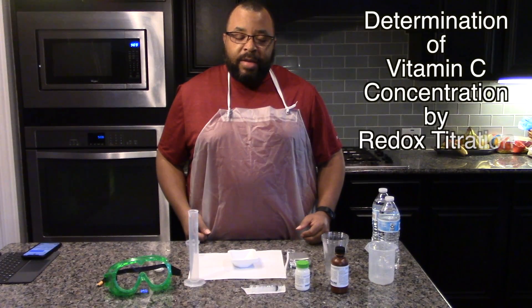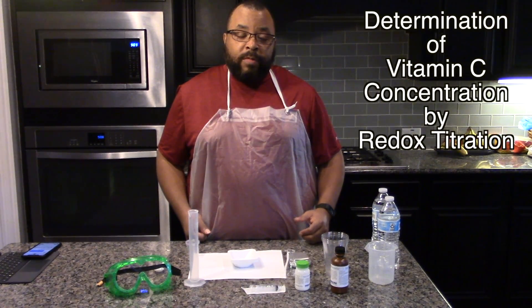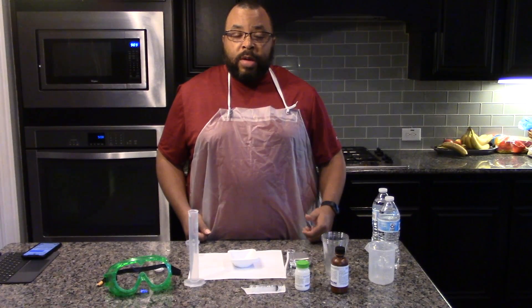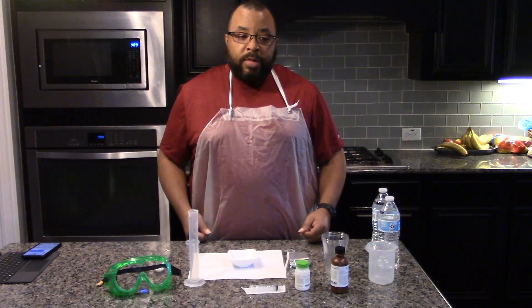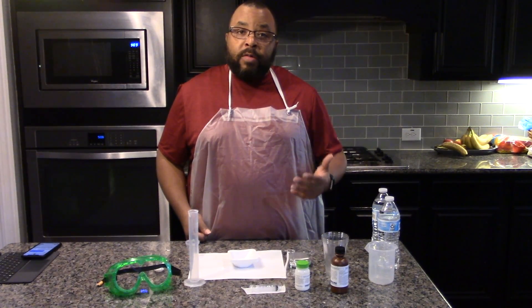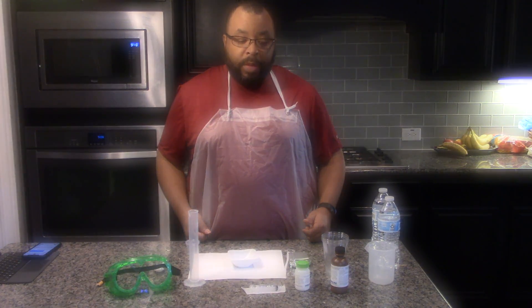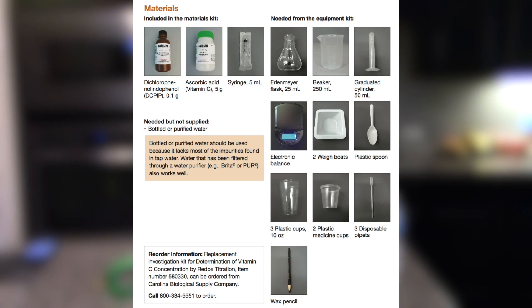In today's investigation, we will determine the concentration of ascorbic acid, or vitamin C, using reduction-oxidation titrations. The first step is to develop a standard curve using solutions of vitamin C of known concentrations. We'll create a graph that you can then compare the unknown sample against to determine the concentration. Let's look at the materials we need to get started.